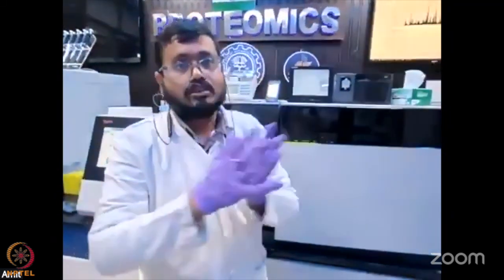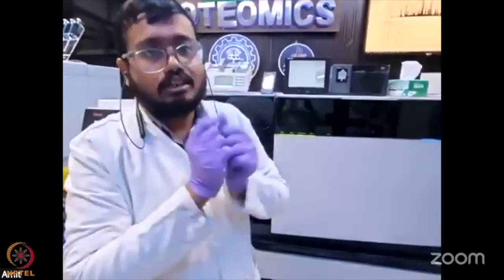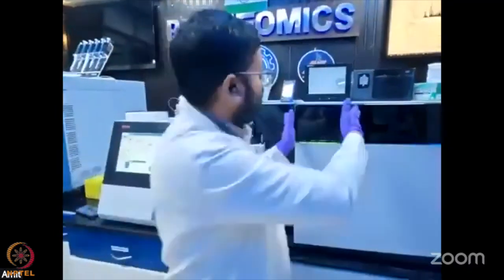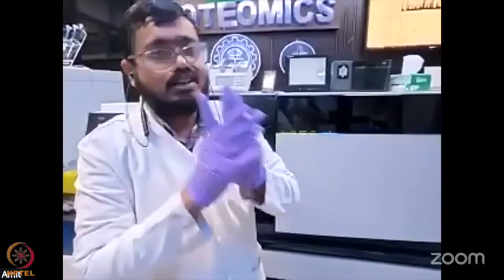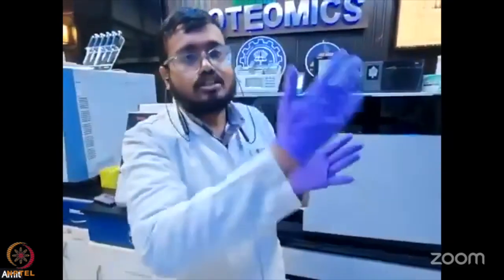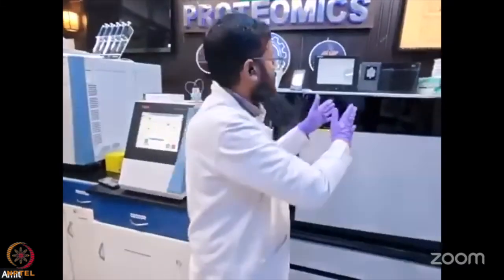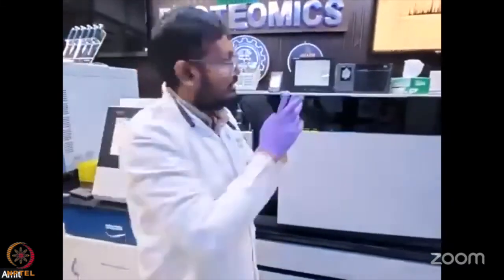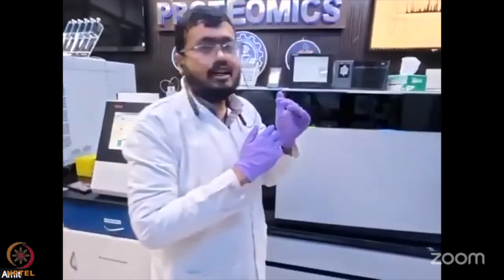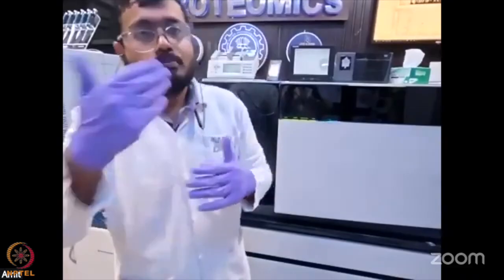Now we talk about LC-MS/MS, the tandem mass spectrometer. MS/MS means there should be two mass specs, because we want to get the sequence of the amino acids. This instrument has three mass analyzers. One is the quadrupole, which we need to segregate the first precursor ion, filtering out a window. The other two are the orbitrap and the ion trap. You can couple the quadrupole with the ion trap, or with the orbitrap.